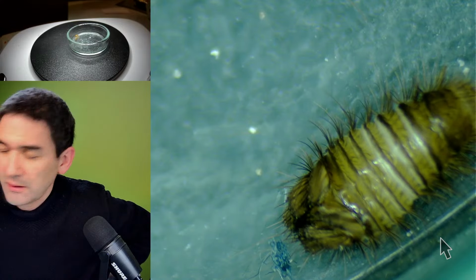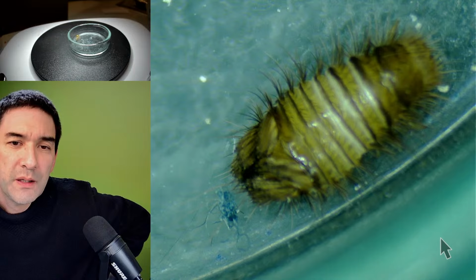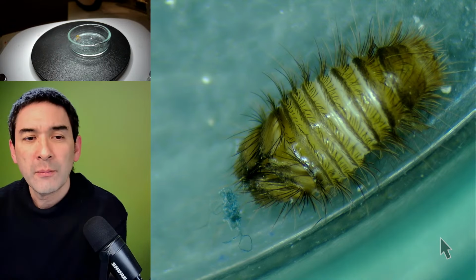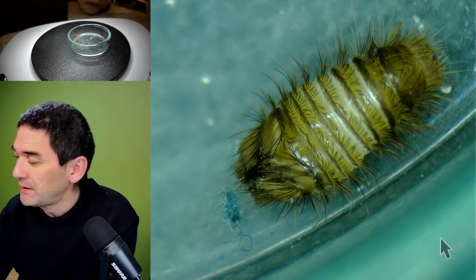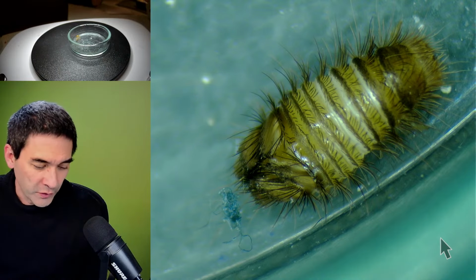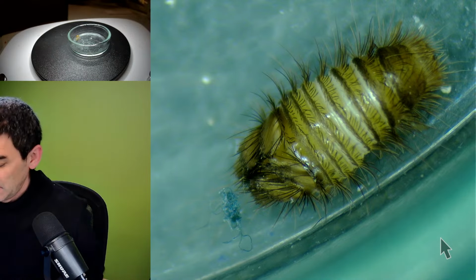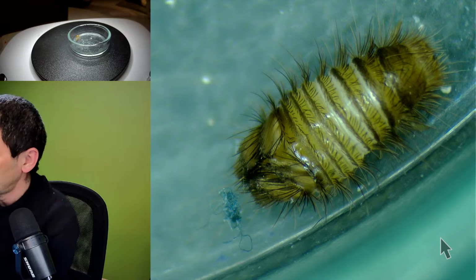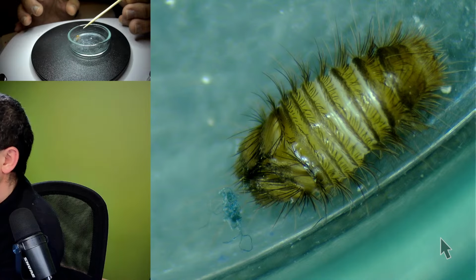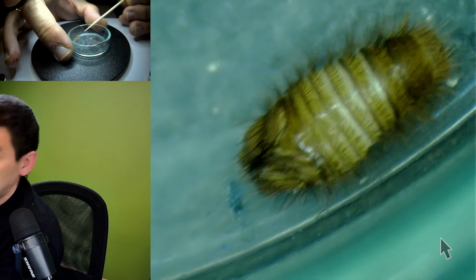Okay. Before it starts moving, I now need a, how do you call this, a toothpick. I hope that it works. The last time it did work, but when you touch the back side, let me move the microphone over. Now I'm going to move a little bit out of the picture. I hope you don't mind, but you should still be able to understand me. So I'm going to now, with a toothpick, where is it? I need to hold it maybe a little bit here.